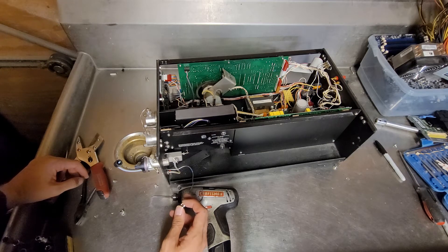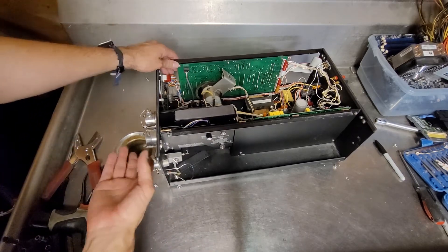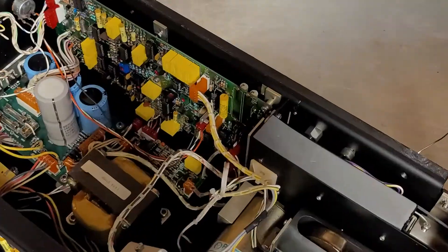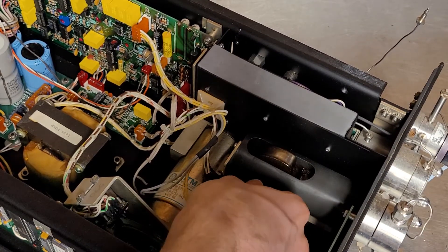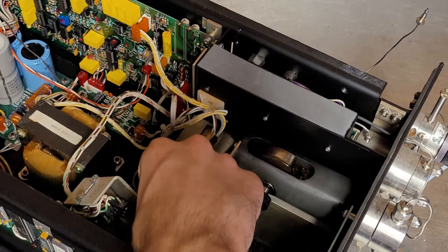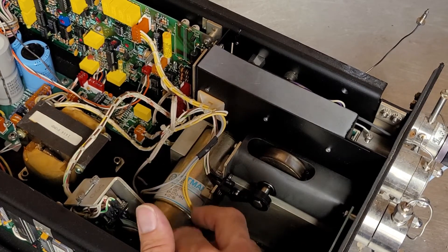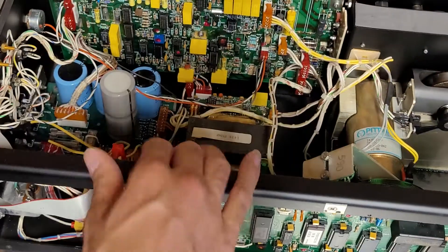Pressure equilibrium. This pump's a little bit more exciting. There's a big flat wheel in here — can't spin that by hand, at least not by the spot I was touching. There's a lot going on in here. I don't know where to start.